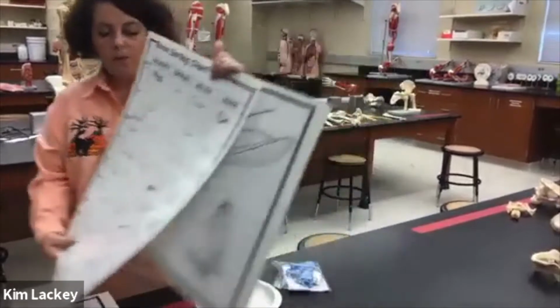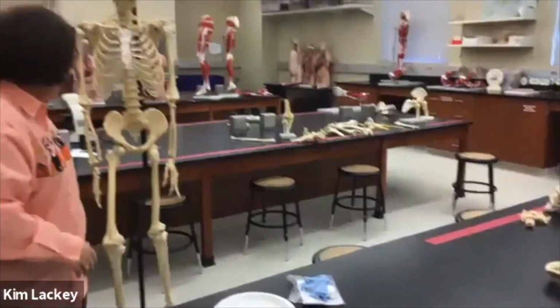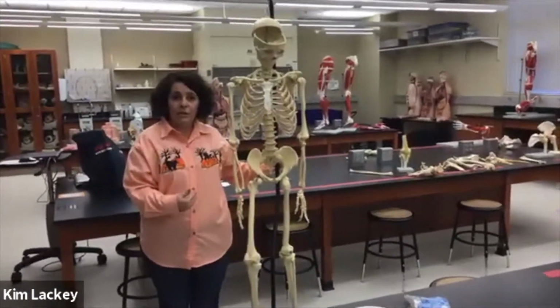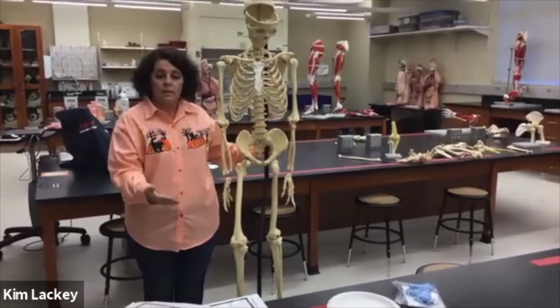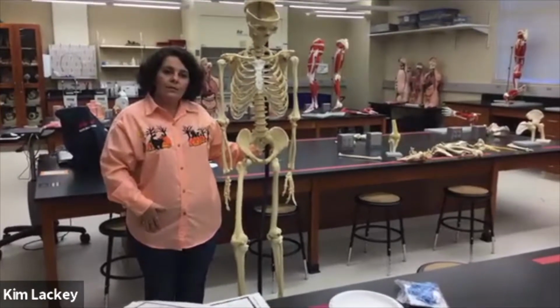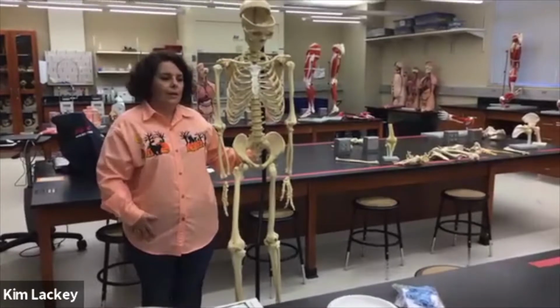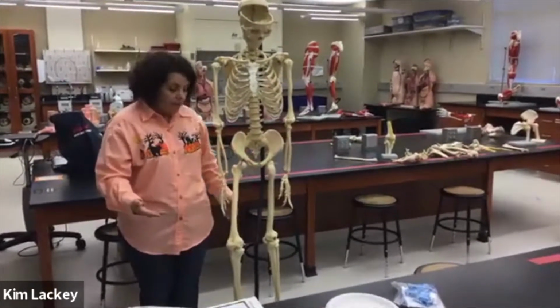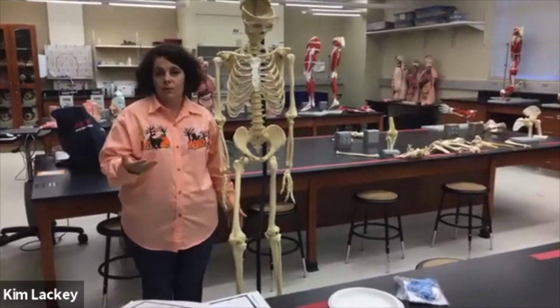As a helpful hint, you've got to think about how our bones have a form and a function to them. That's going to be the same in the moles and the voles and the birds. So when you're trying to identify some of these bones, think about and relate it to what its function is in humans. Some of the larger bones, you'll find your femurs, your humerus, your radii, those will be in there.